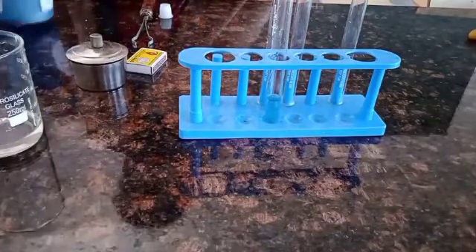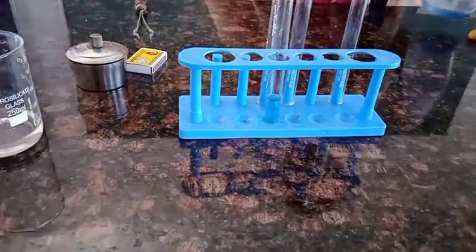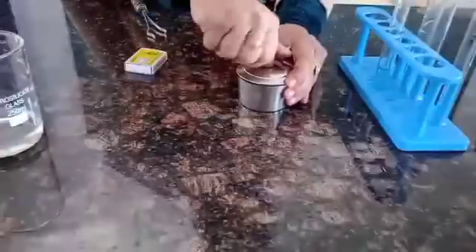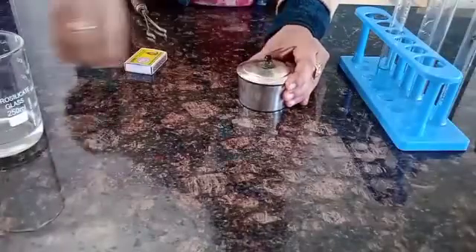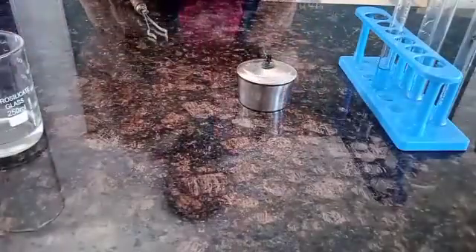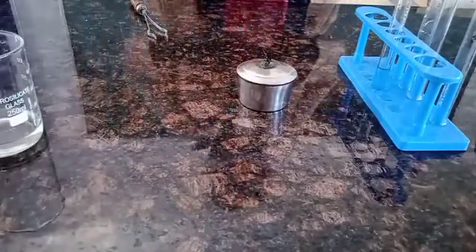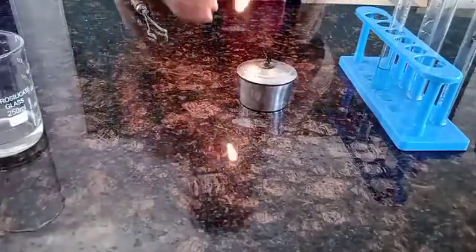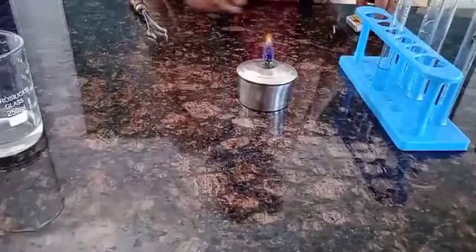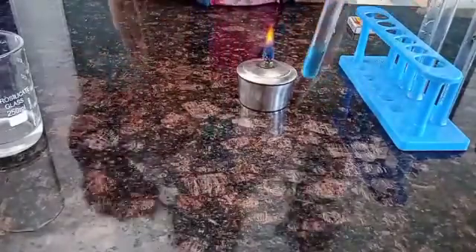Now we are going to heat the test tube, holding it with the help of a test tube holder under the spirit lamp. We have to keep the test tube in a slanting position and give it intermittent heating.